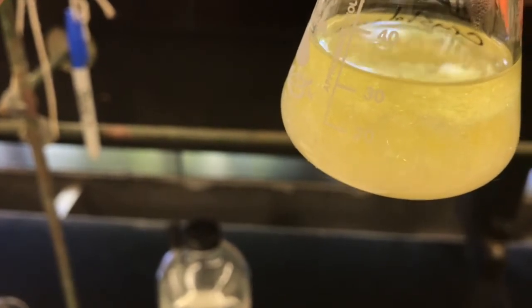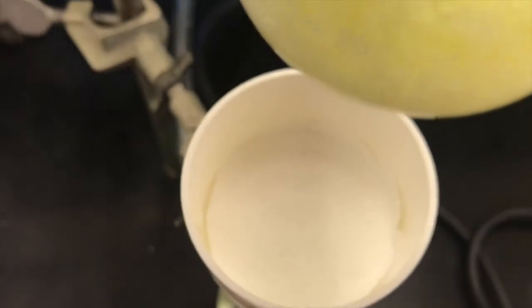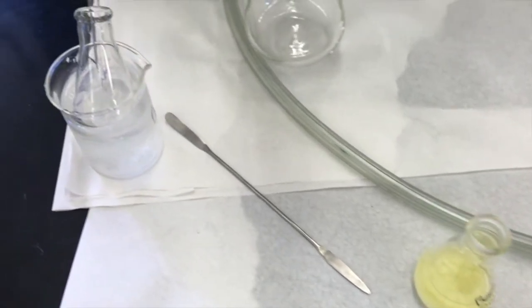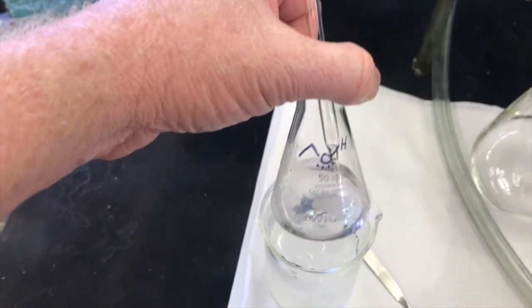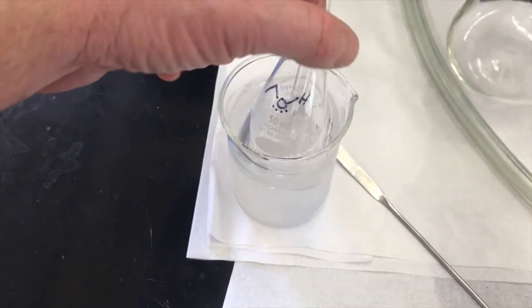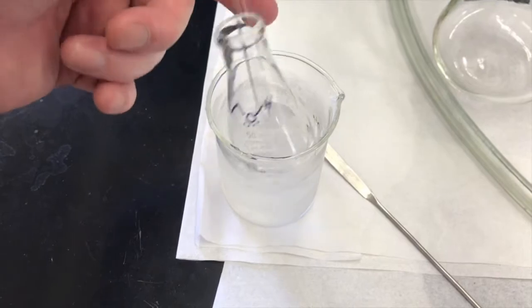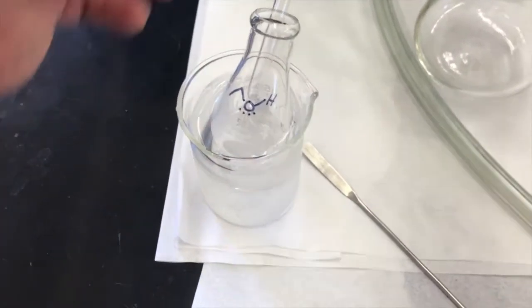and using ice cold ethanol to help wash the crystals over and wash them off. And I'll use vacuum filtration to draw that mother liquor through the filter paper quickly. Okay, I've taken my flask that I used to heat up ethanol for the crystallization. I added extra ethanol to it, and I've cooled it down in an ice water bath. I've chosen a beaker that won't let this flask fall over. Don't choose a beaker too big, because then the ice melts and it can fall over.